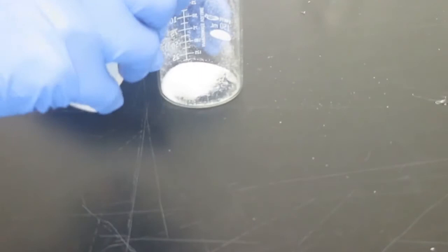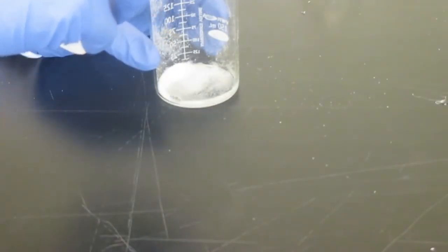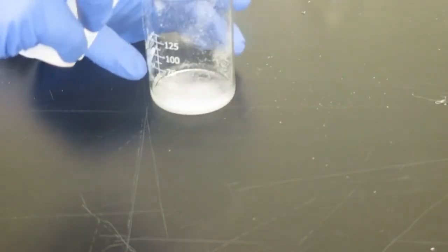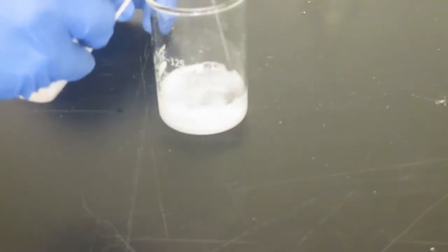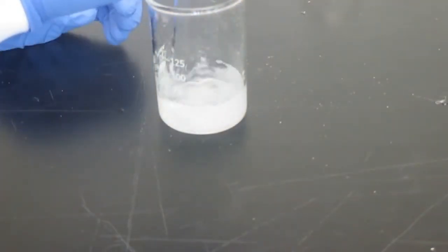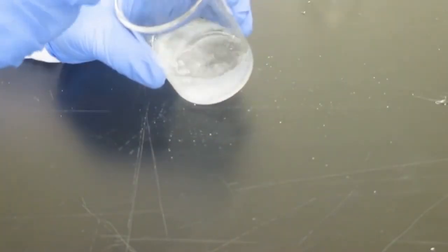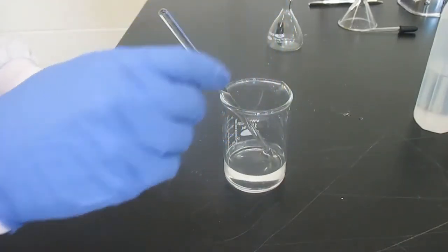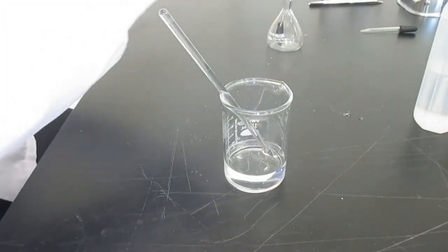So now I'm going to dissolve this in about 50 mils of water. And I'm going to make sure it's all dissolved. I don't want any crystals left on the side of my beaker. Okay, so our crystals look dissolved now. I actually snuck it on the hot plate while you weren't looking. It was pretty hard to dissolve.